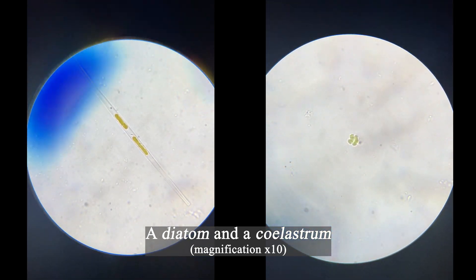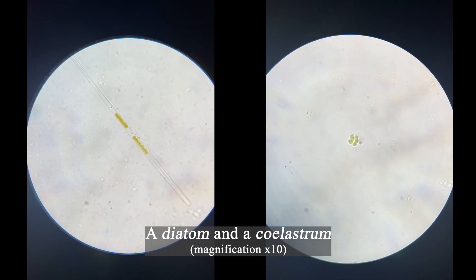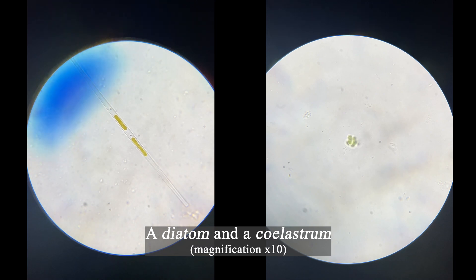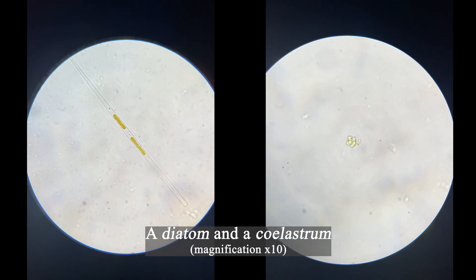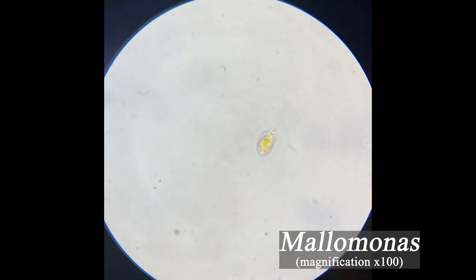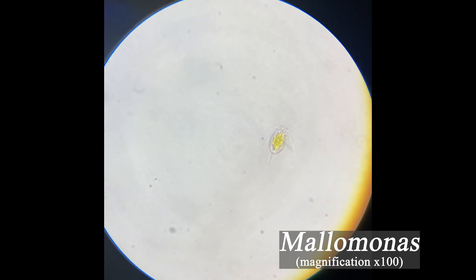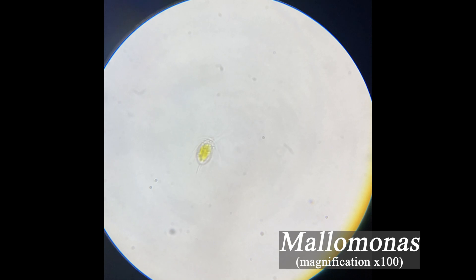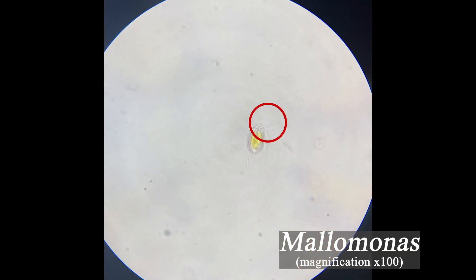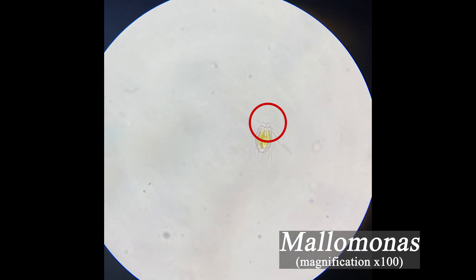For the plankton part of the puddle I found phytoplankton, a diatom, and a Coelastrum algae. Diatoms by the way generate about 20 to 50 percent of the oxygen produced on the planet each year, so they are quite important microorganisms which can be found in fresh water, oceans, and in the soil as well. In the benthos I found a lovely organism from the Mallomonas genus. This algae consists of individually living cells covered in silica scales and bristles, with two flagella — one short and one long — easily seen in a light microscope. Mallomonas uses its long flagella to move, and here our little fellow shows how nicely and fast it can utilize it.